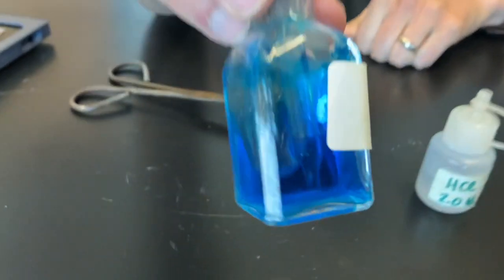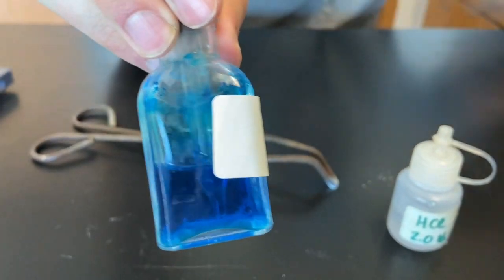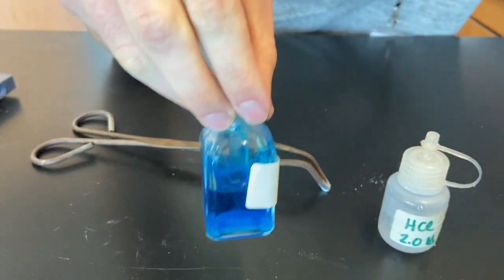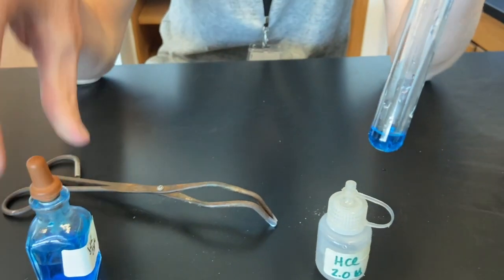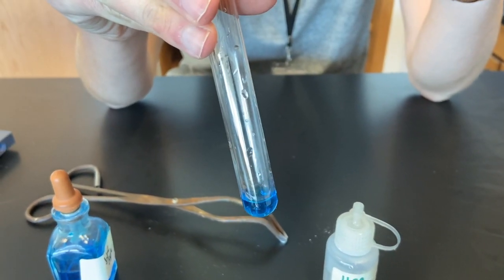So here's the blue dye. We've actually already poured 15 drops of it into the test tube here.